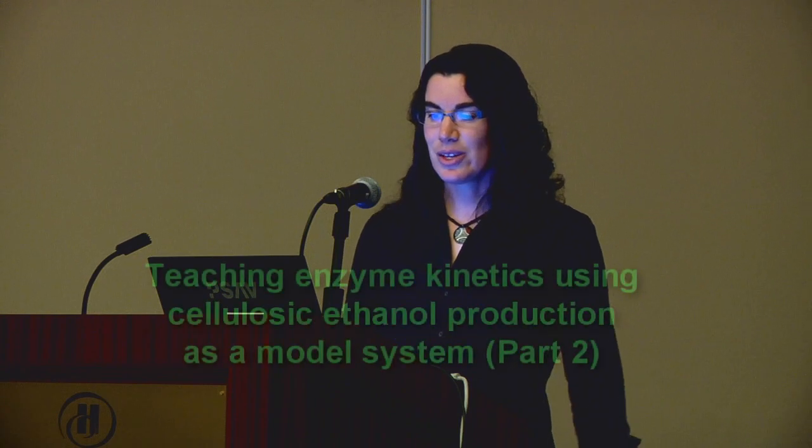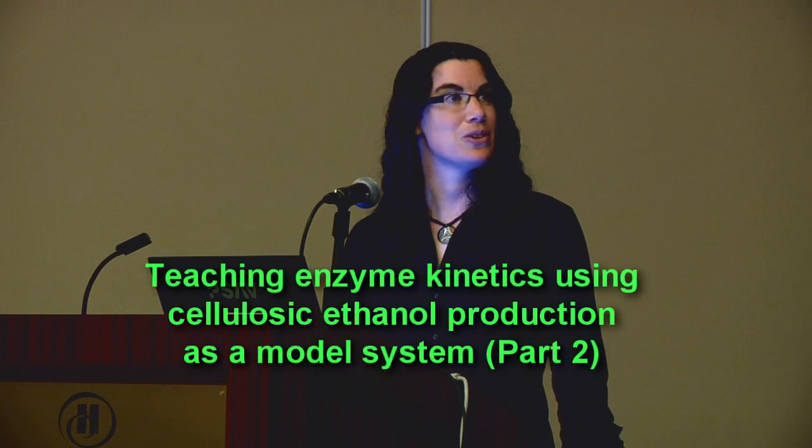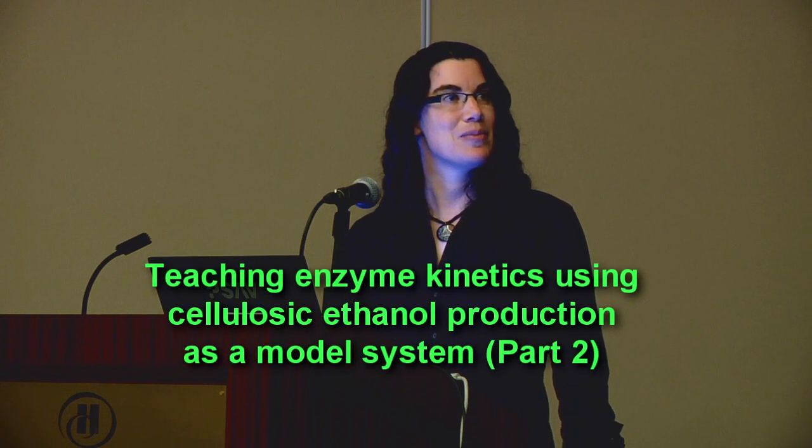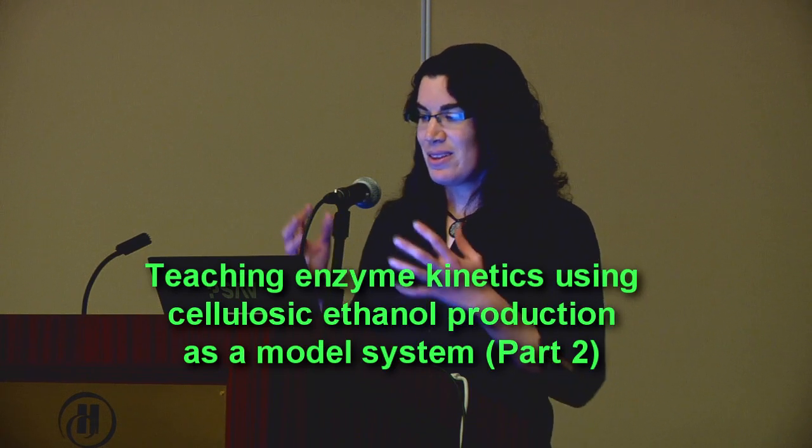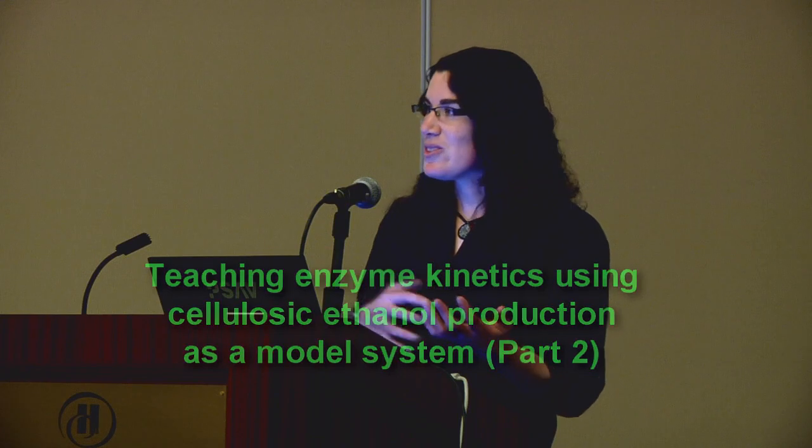In industry, this is actually how they do these analyses. You've got the cellobiase breakdown of paranitrophenyl glucopyranoside. Your enzyme comes in and it breaks it down. Students don't like clear things going to clear things — the paranitrophenyl in acidic reaction conditions is still clear. However, if you change the conditions to a basic condition, the paranitrophenyl has a resonance structure and now it's yellow.